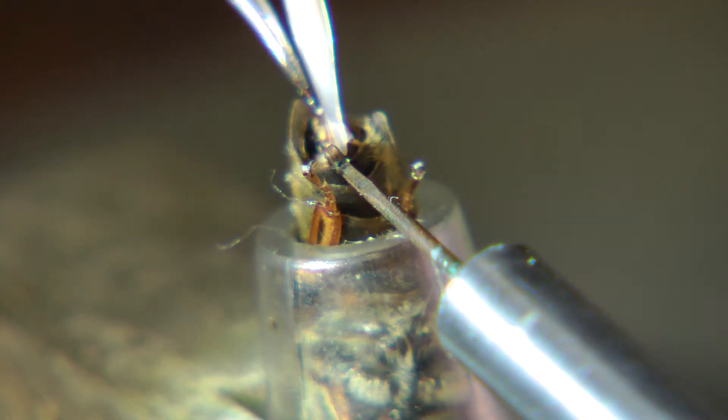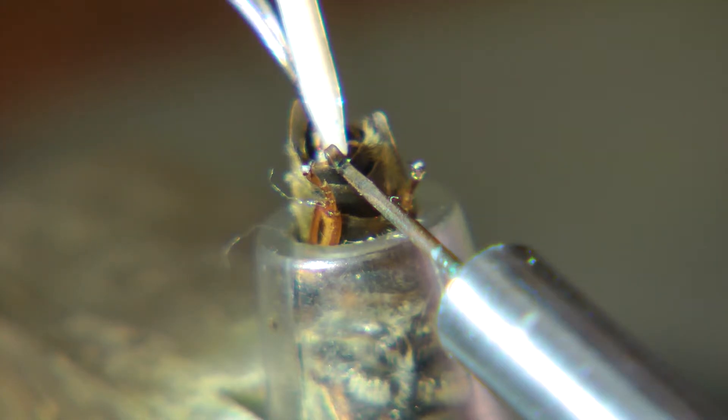I'm going to put a little bit of saline right there. I think I've got it. The clicks are from the syringe pump.